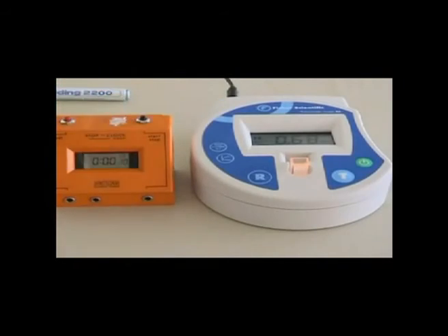2.5% protease solution. Starting reading this time is 0.68. Remember that it doesn't really matter what the starting reading is, because it's a question of the initial rate of reaction. In actual fact, the substrate concentration used was the same each time, so variations in starting reading are due to vagaries of the colorimeter.